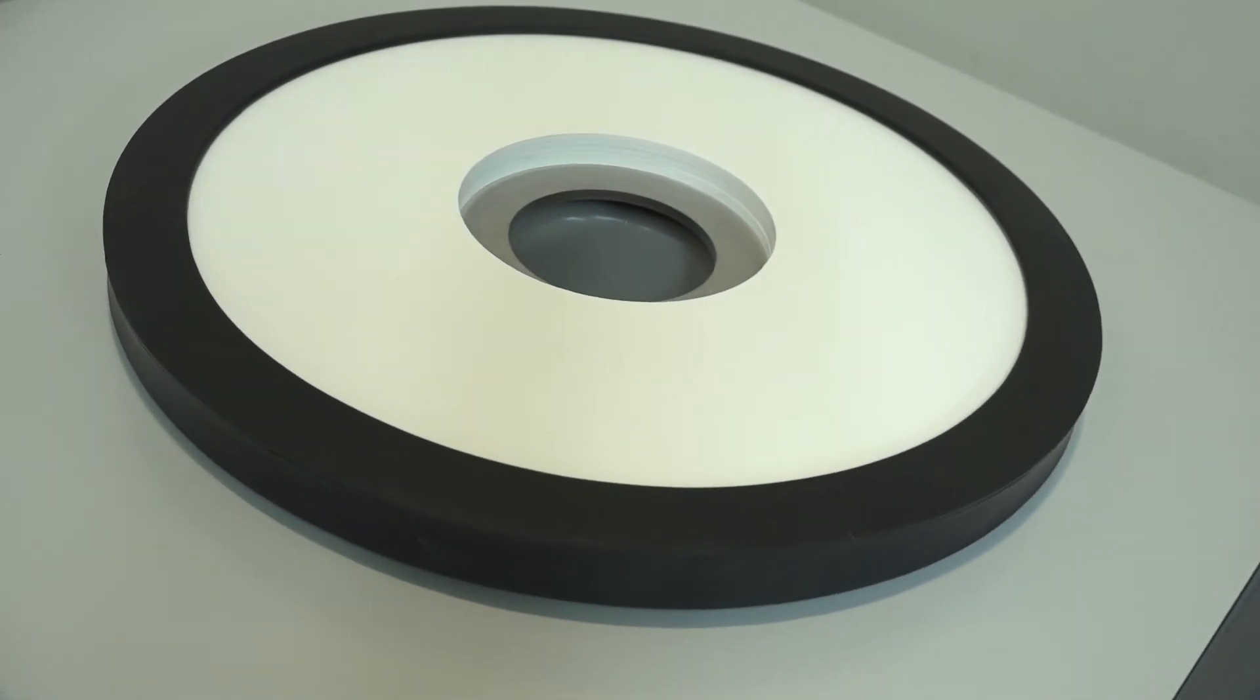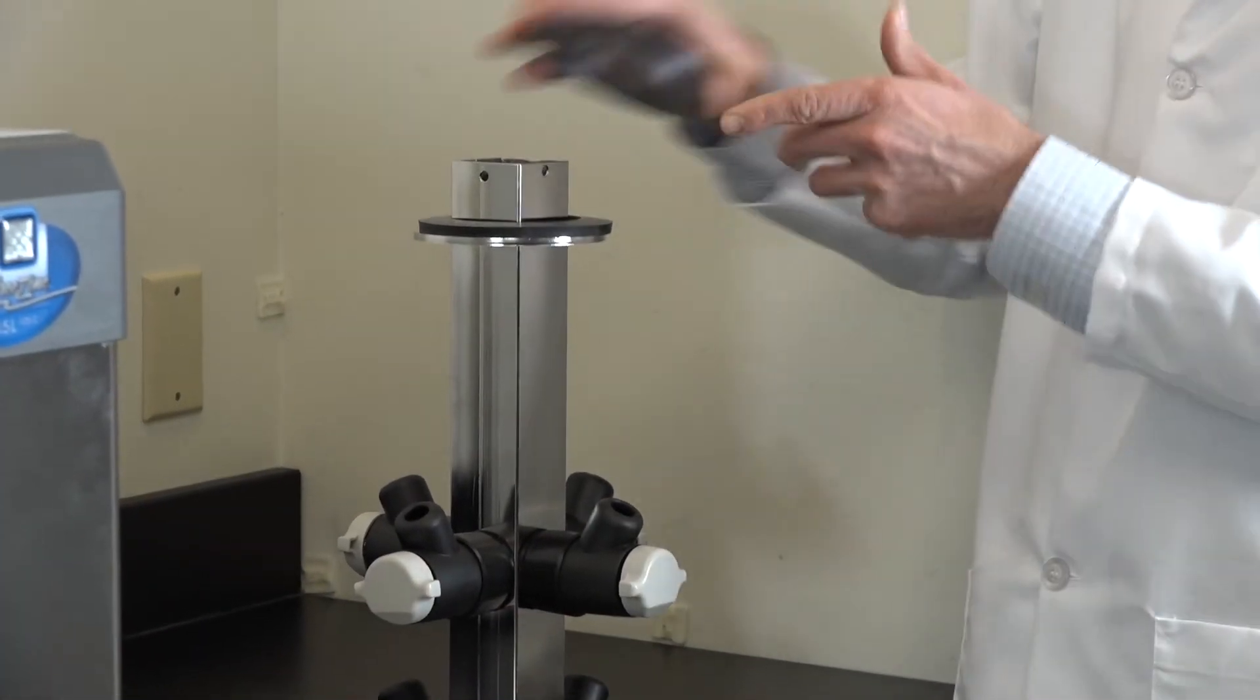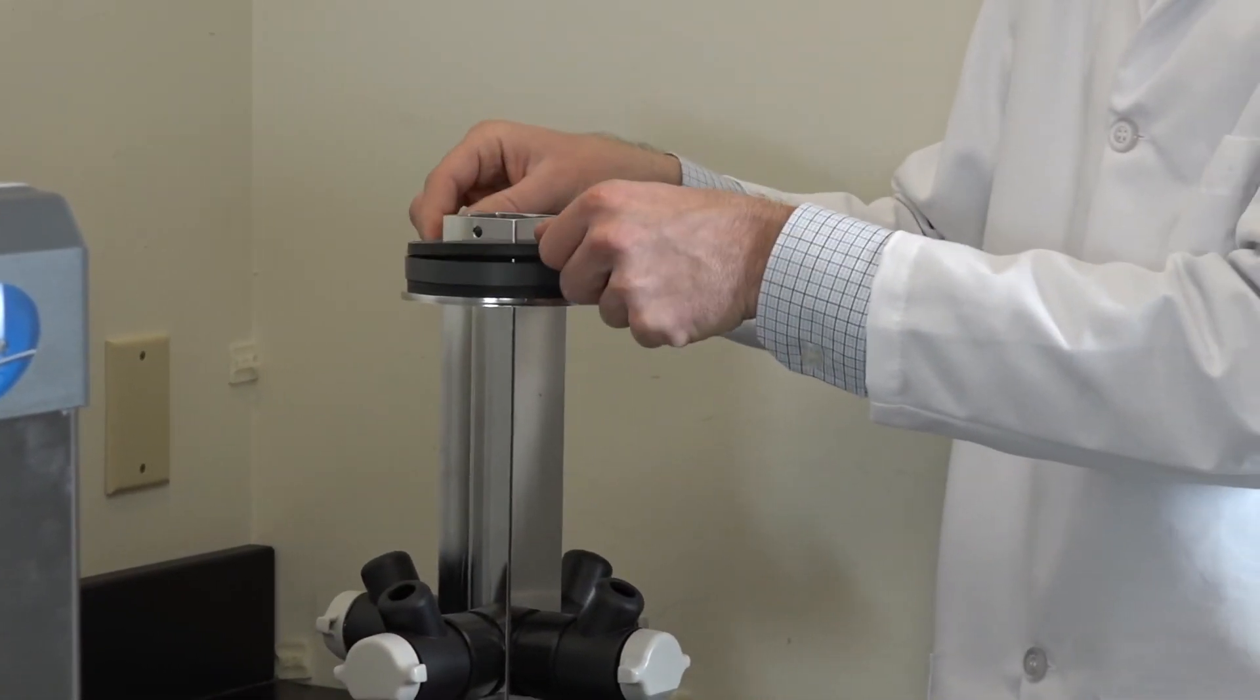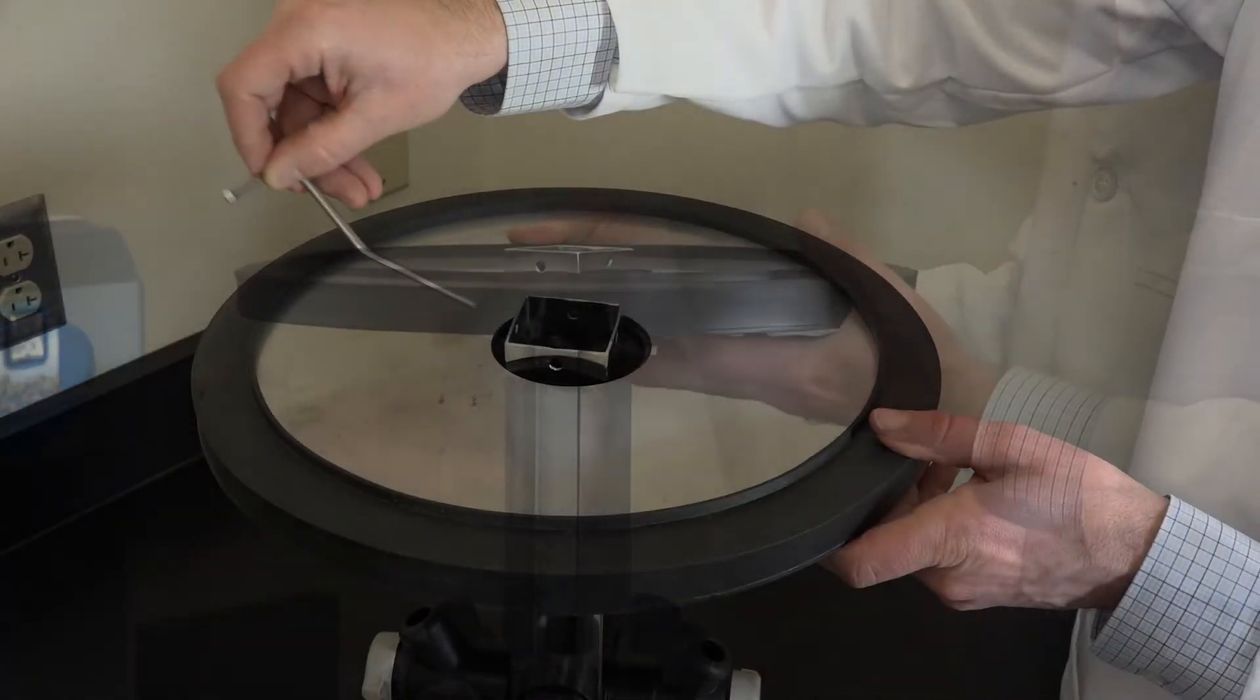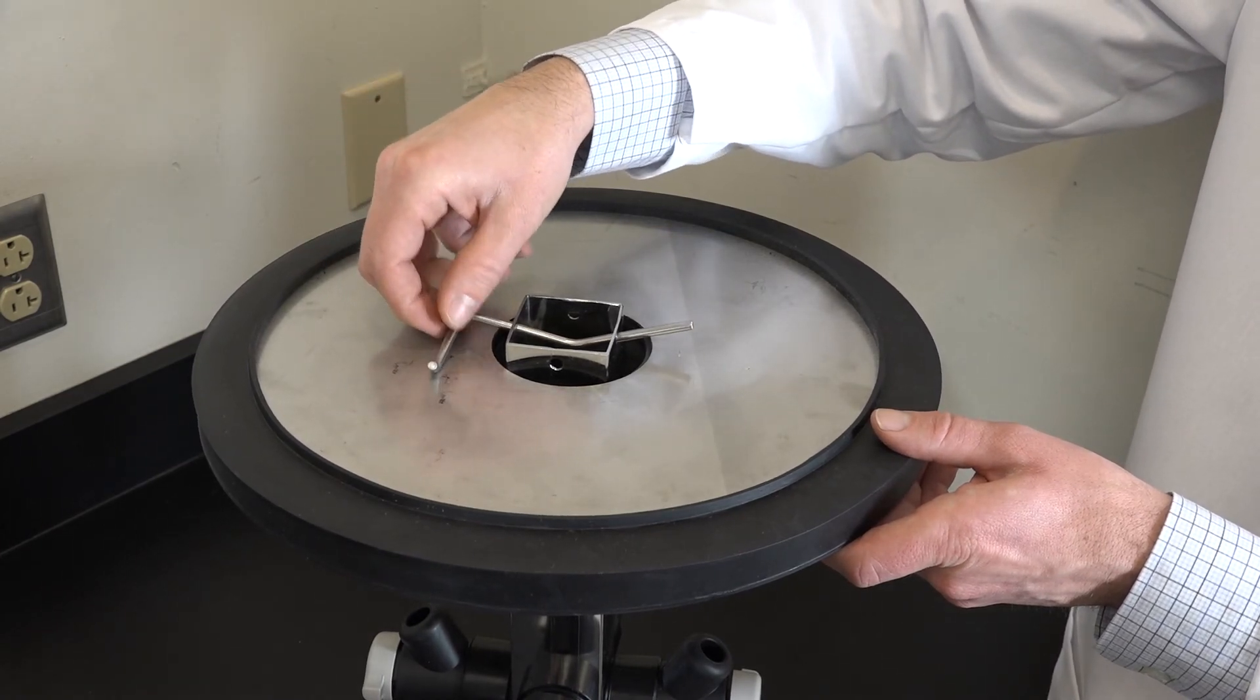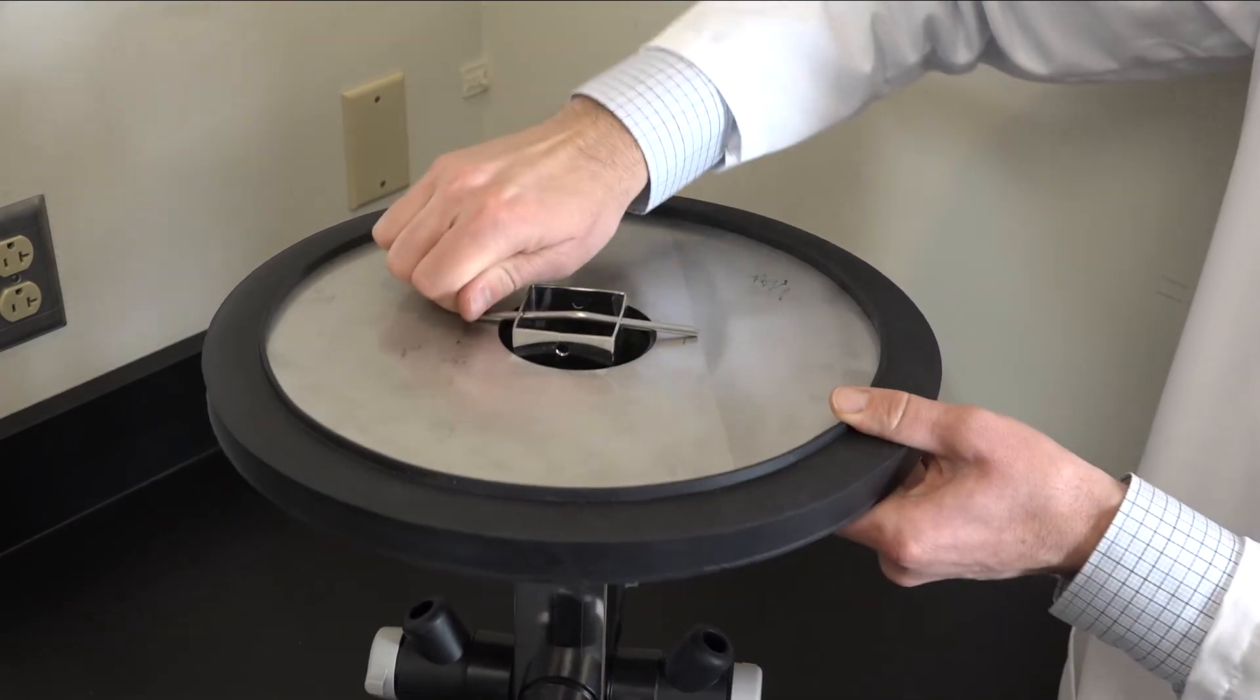If the collector lid is stainless steel, stack components onto the manifold in this order: first the gasket, then a gray acrylic spacer, another gasket, then the stainless steel lid with the gasket centering ring facing upward. Slide the latch pin through the upper set of holes in the manifold. Push the pin through the collar until the bend of the latching pin is in the middle of the hole. Turn the pin so the assembly is latched.